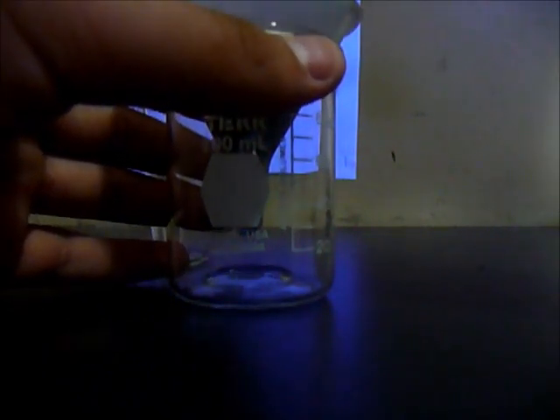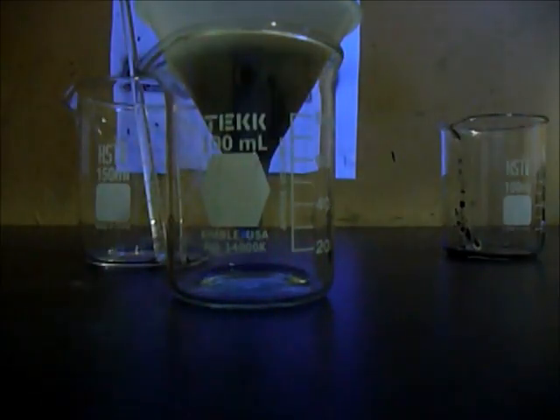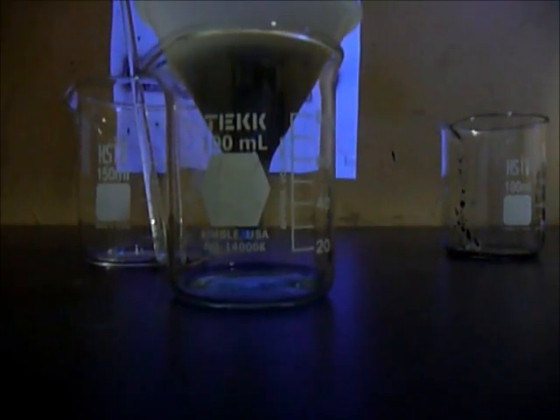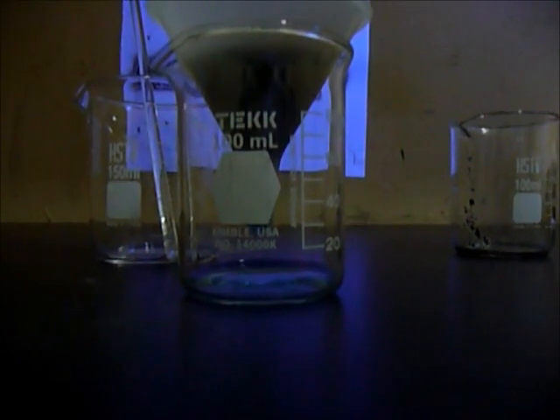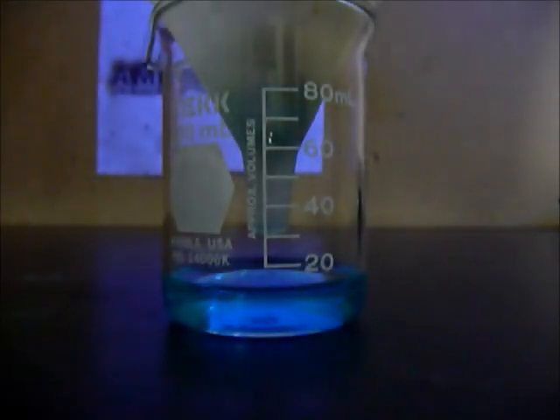This is not the purest way to make your copper sulfate, but it works a little bit. So I will be showing you when this is done.